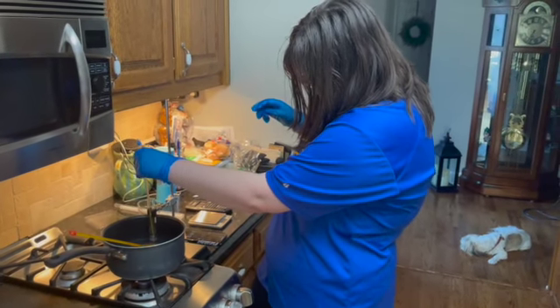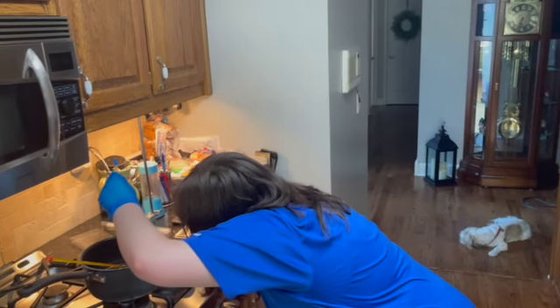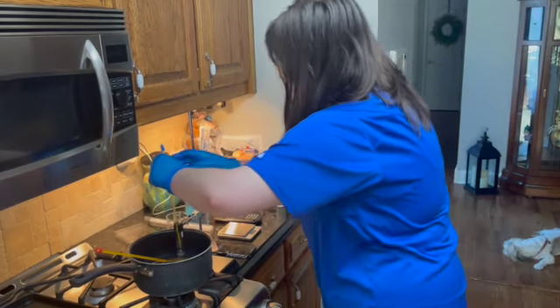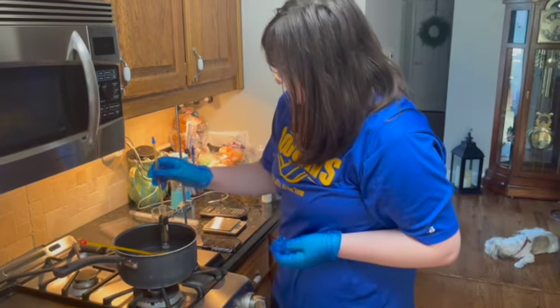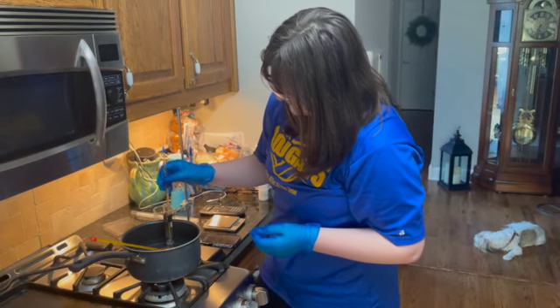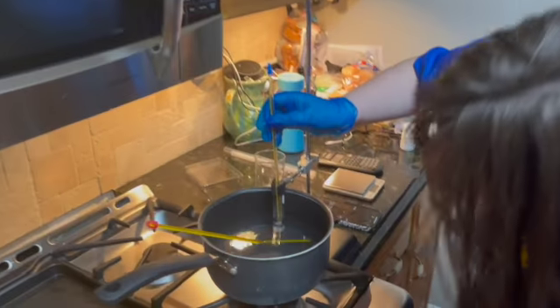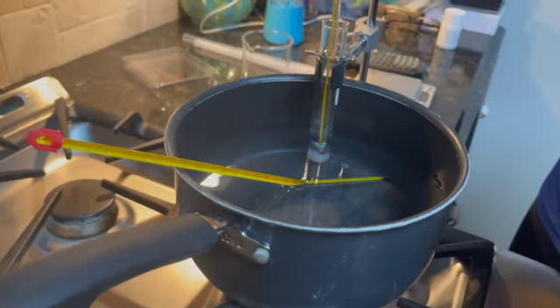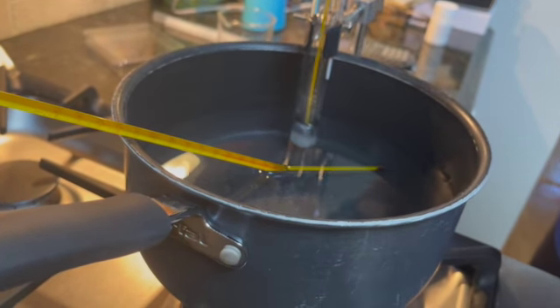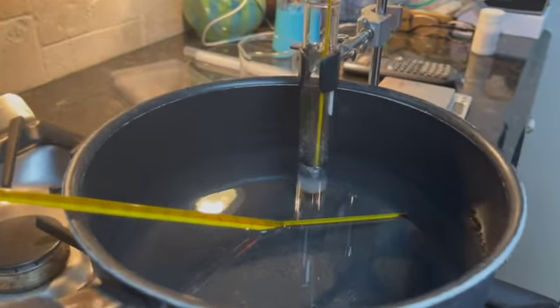And if I can look a bit closer, there's still a good amount of it at the very bottom that is still not melted, so we gotta continue. But the majority of it has completely melted by this point. Let me just keep getting a closer look. Actually, looking closer at the side as it is liquidated, it isn't that cloudy white that I thought it was previously, because that looks to be more of what the solid is showing me than what the liquid is. From what I can tell, the liquid is completely clear.